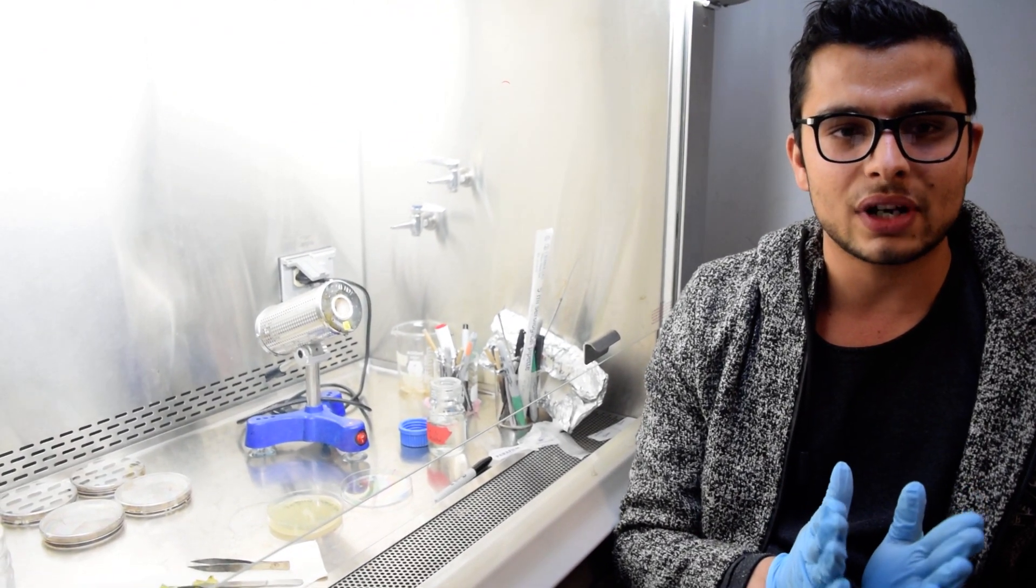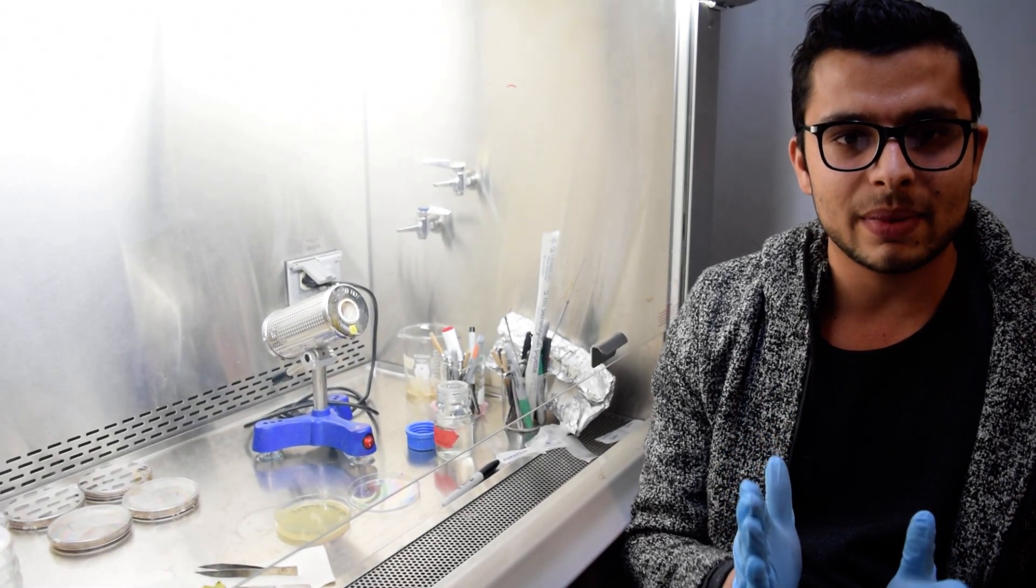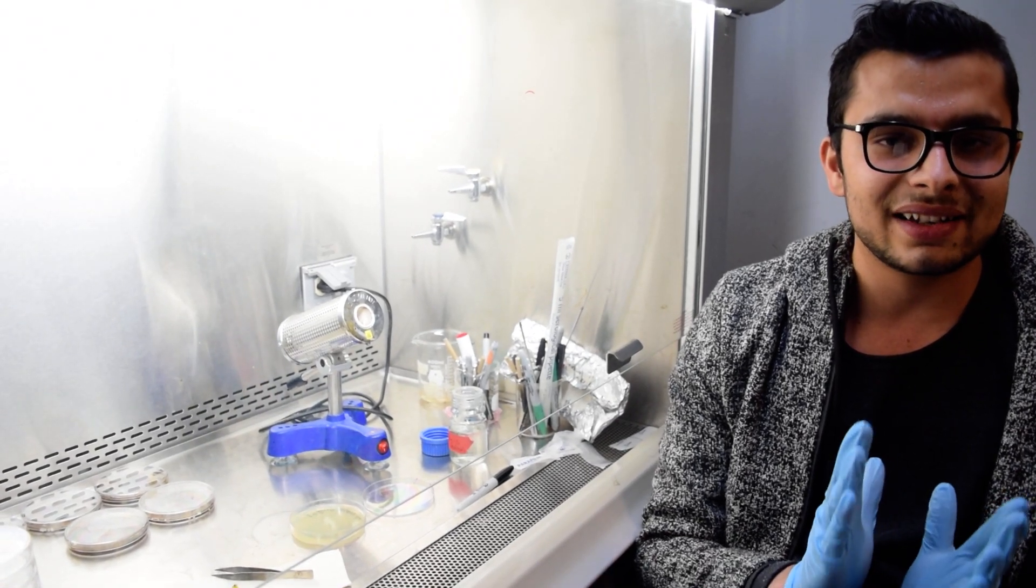The major importance of plating is to identify and isolate the disease-causing factor and to recommend the management practices. For plating, we have to follow a series of steps.